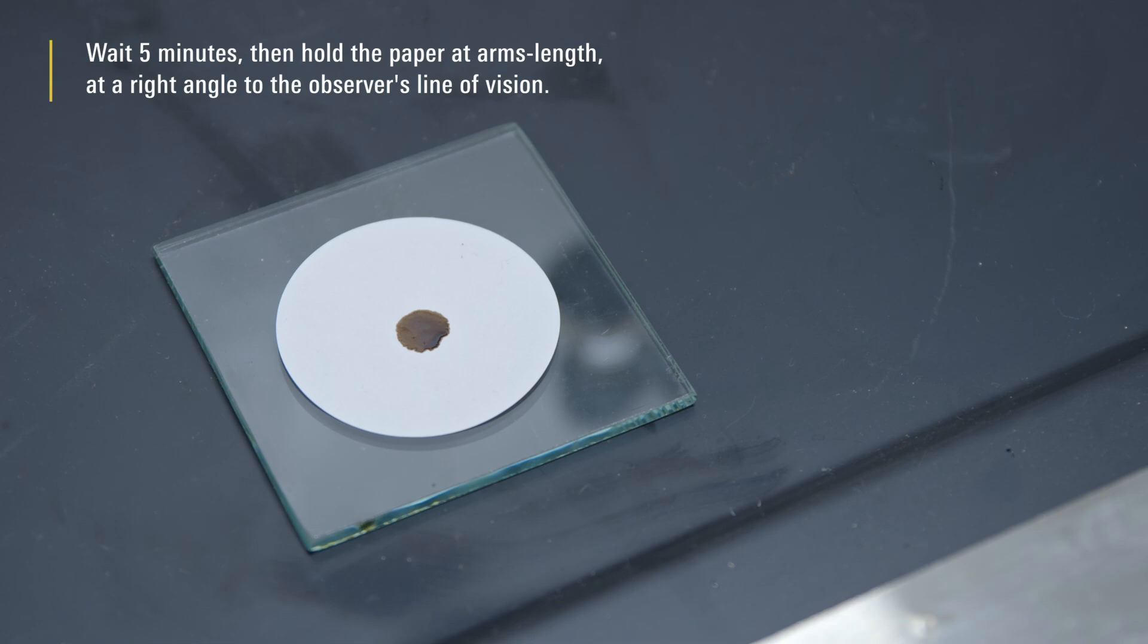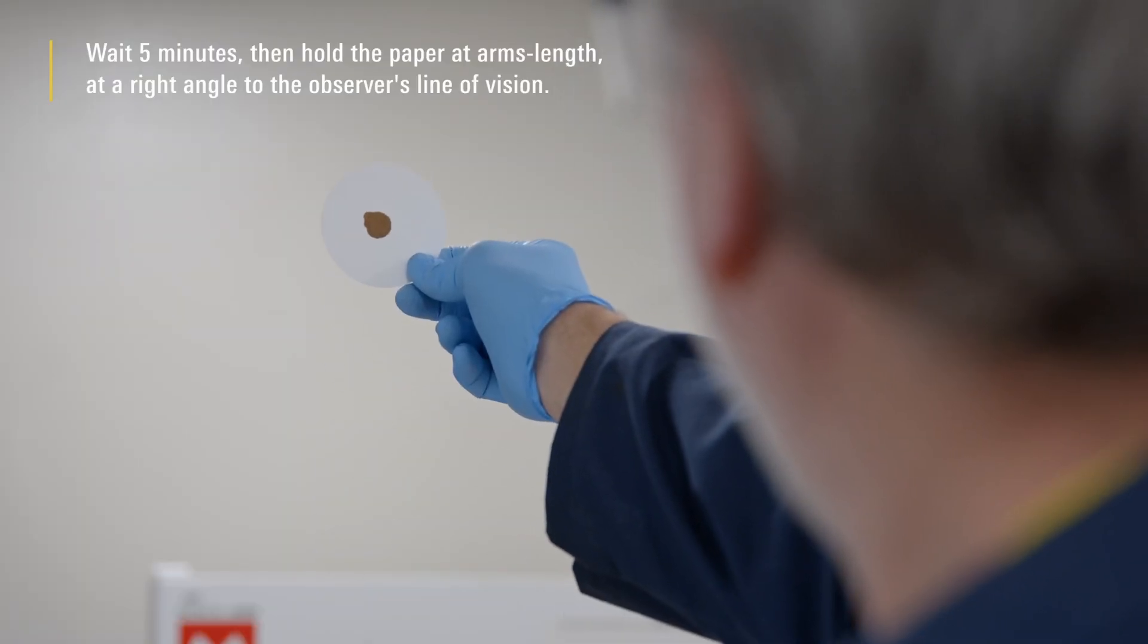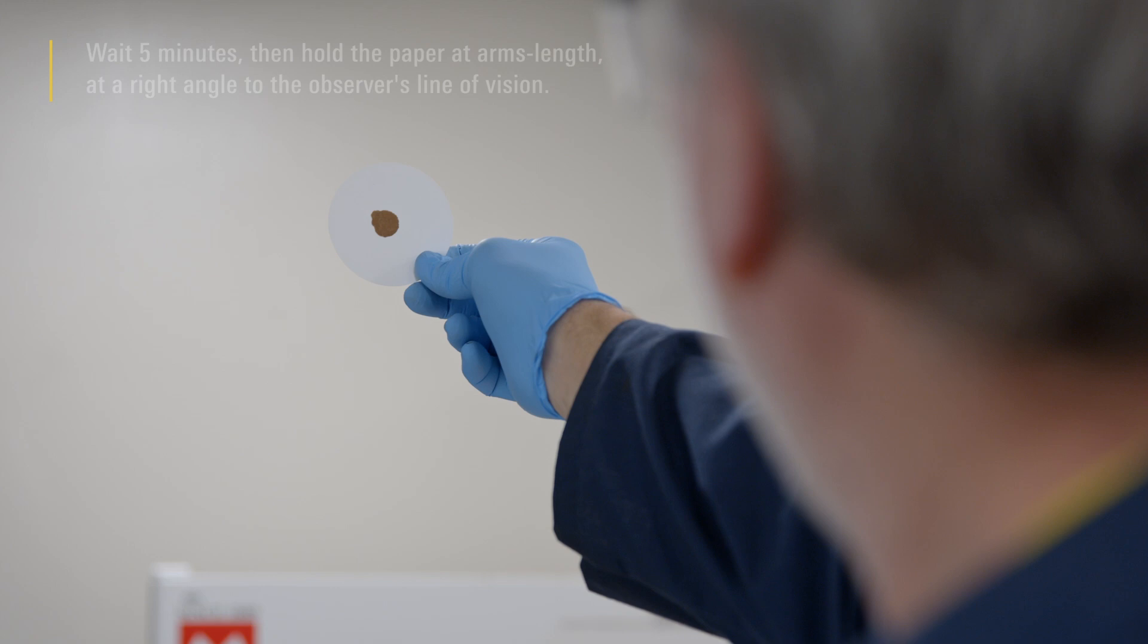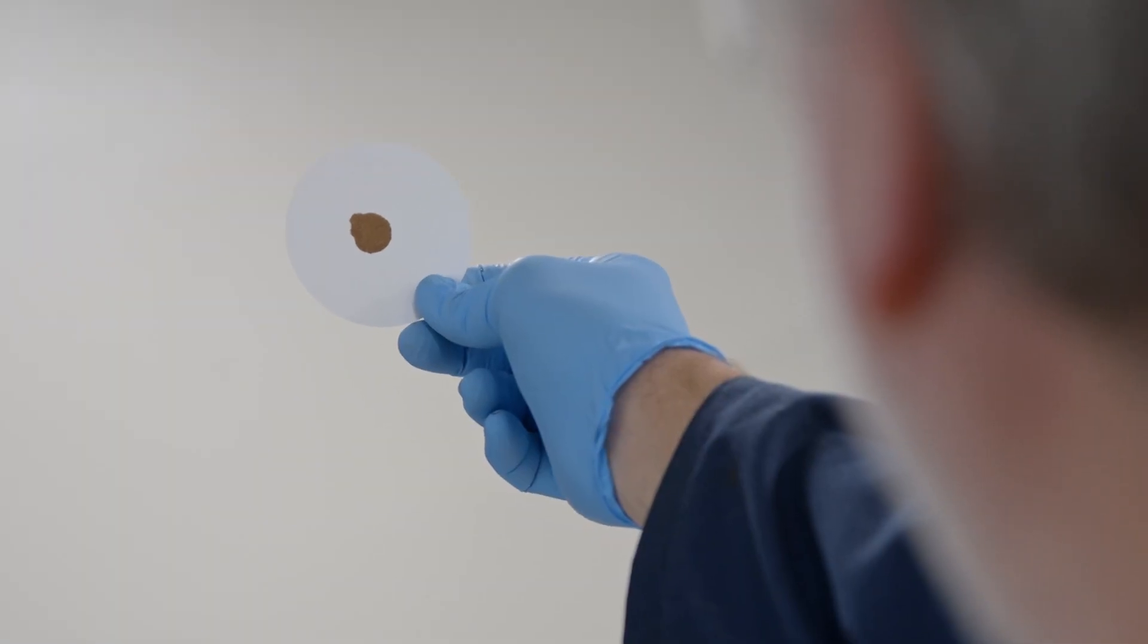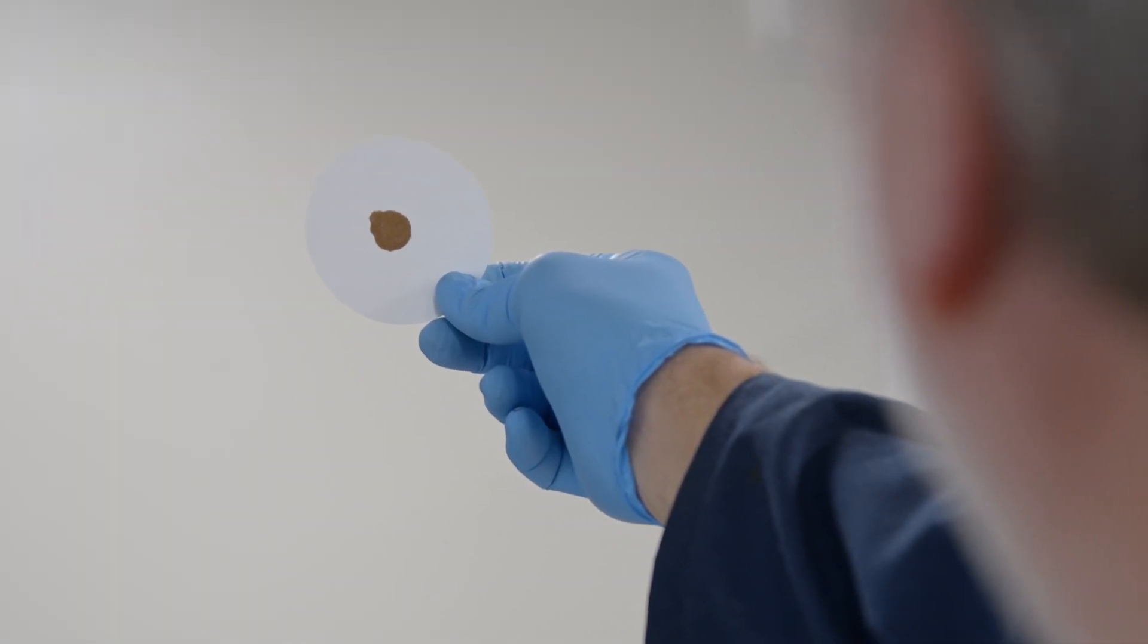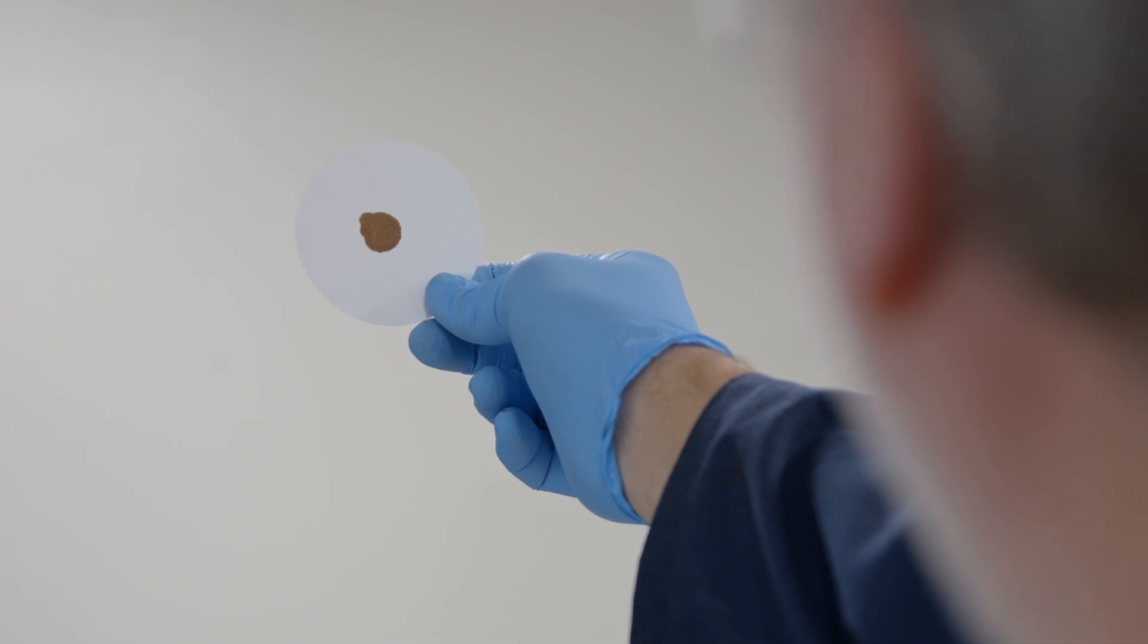Wait 5 minutes, then hold the paper at arm's length at a right angle to the observer's line of vision. Ensure that there is a good light source at the observer's back. Diffuse natural light is preferred.